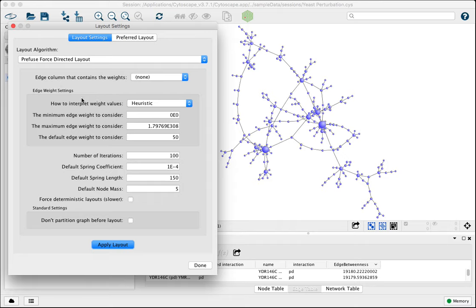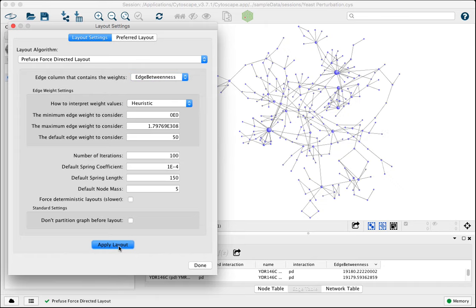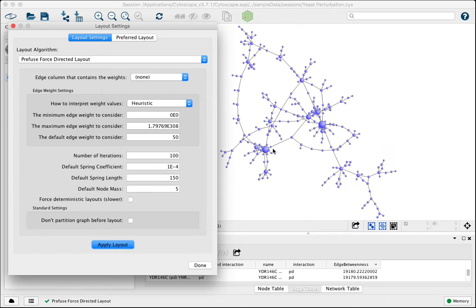The last thing I'll point out here is that some of the layout algorithms, including the Prefuse force-directed layout, also let you take edge column values to use as weights. So in this network, we have an edge betweenness score, for example. You could specify an edge column with data values that you have. And again, play around with these values and these interpretation weight metrics, and they'll dramatically change your network as well. You can always turn that back off until you get a network you like.